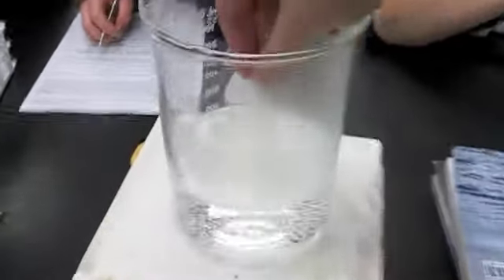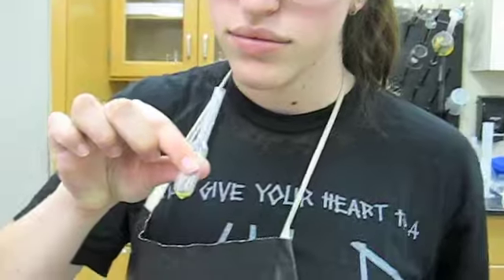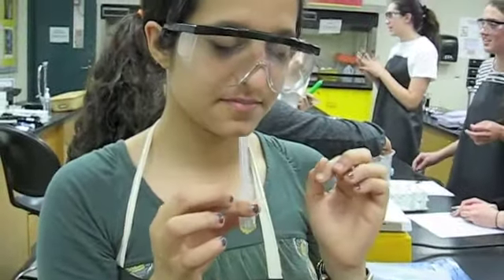When the 2 minutes are up, take out the cork and squeeze the tube and sniff. After you and your lab partners have smelled the mixture, record on a piece of paper which alcohols and acids you chose to create your ester and what you decided it smelled like.